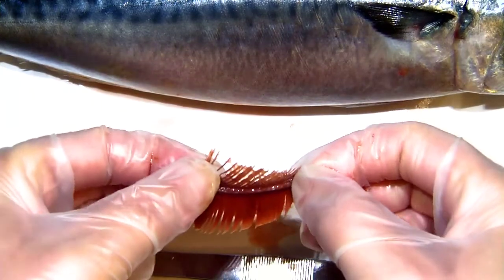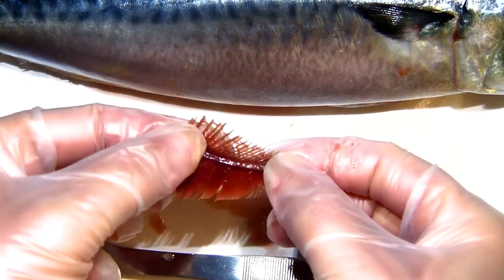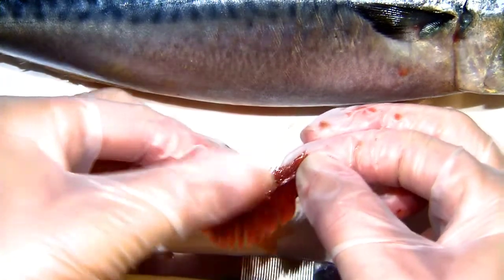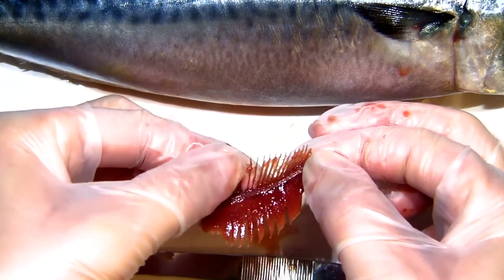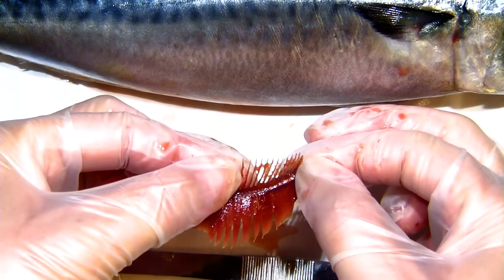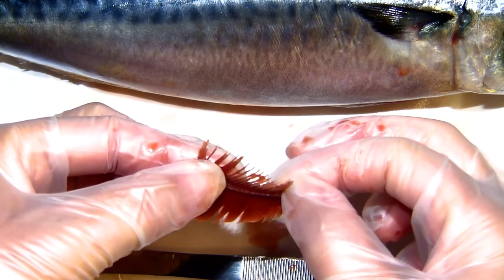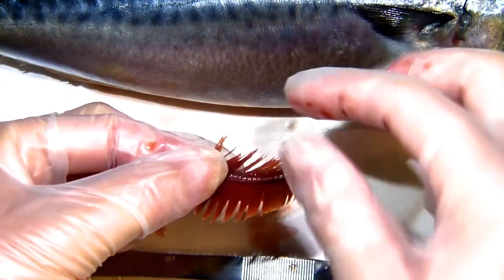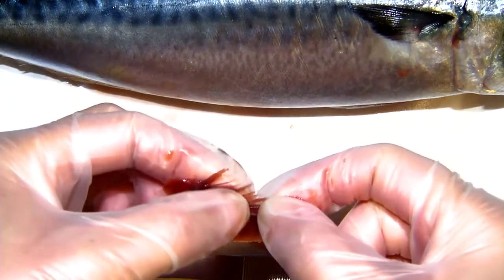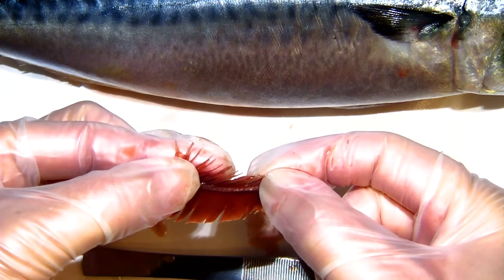Here's a really interesting thing — I can bend the gill a little and you can see some parts sticking out. These things right here are called gill rakers. These gill rakers are a little bit stiff, and that stiffness is actually a really great thing. Just like the name says, the gill rakers actually rake things — they rake water. If the water has particles in it, which it typically does, the rakers will actually catch the particles before they hit the filaments, that way the filaments don't get damaged.